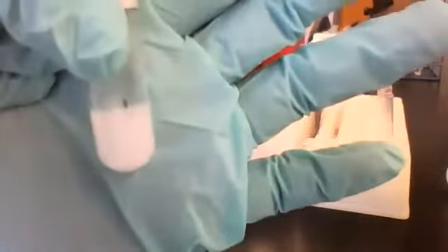And to me, this white color looks a lot more milky than the first two that we saw. So again, since there's solid at the bottom and solid dispersed through it, that clearly is not dissolved, would we call this a solution or a precipitate?